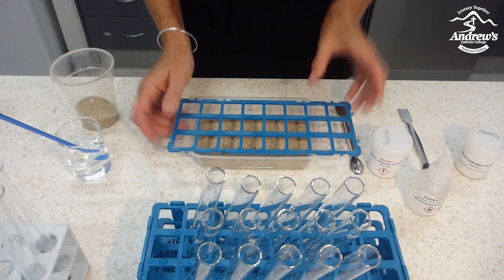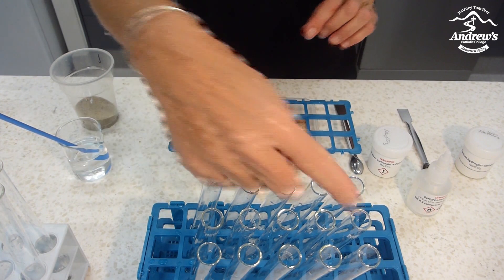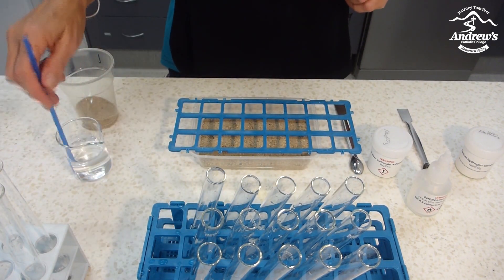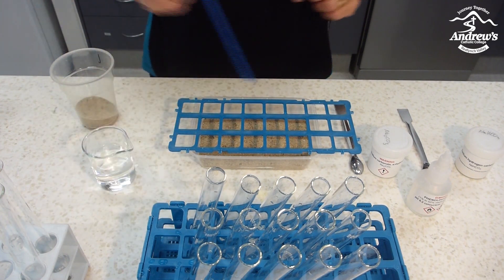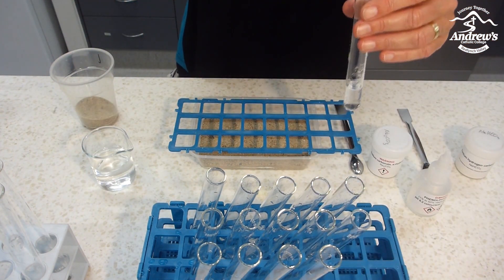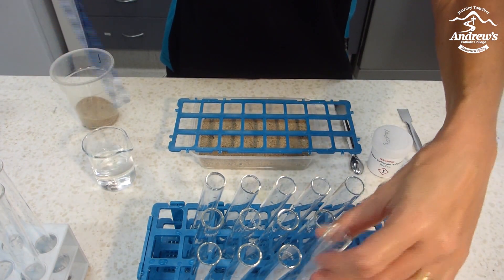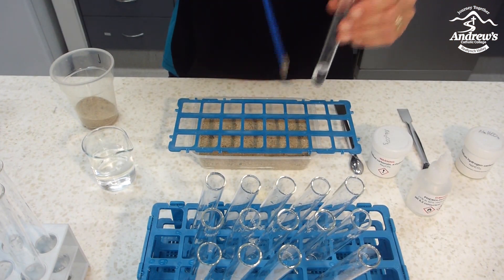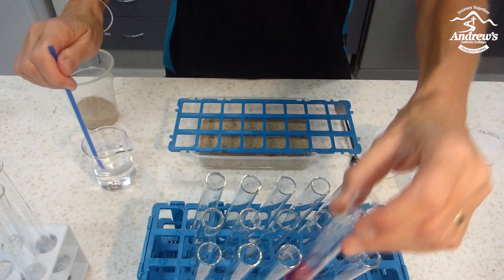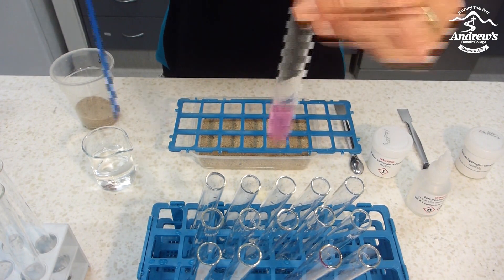Put the grid on there. Now this comes from the test tube rack, so five by three is the same as five by three in the rack here. We're going to use the wedge straw and take the sample from each grid square and put it in the test tube. You will see some of the test tubes will change color — just continue all the way through.